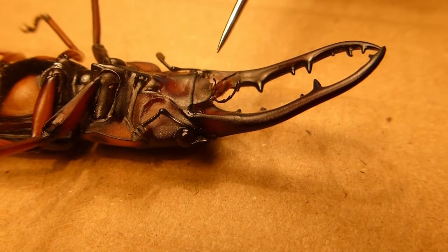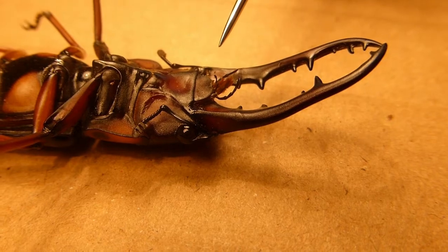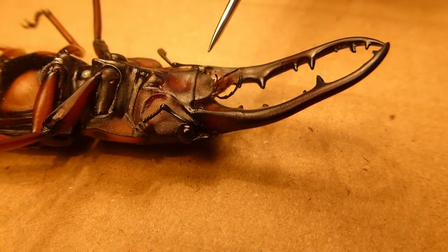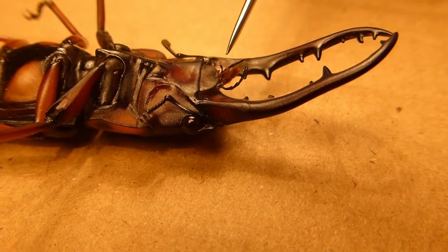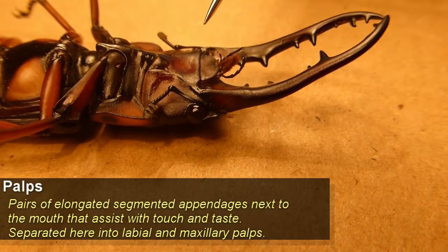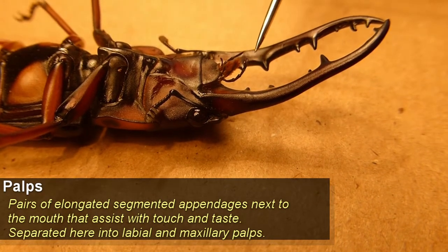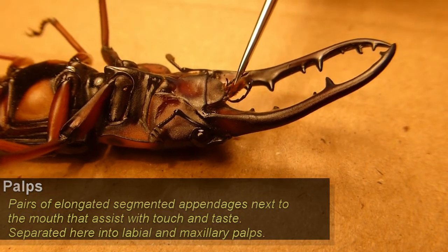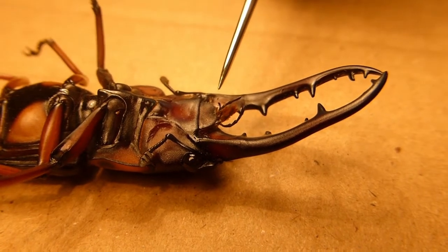Unlike some species of beetle that do not eat as adults, this one does — it has mouthparts which you can see here. Some species will just rely on the energy reserves they built up as juveniles, however this one will eat. The mouthparts are divided into three sections: the smaller ones at the bottom are the labial palps — labial meaning lip — then the maxillary palps up here, maxilla being the equivalent of the jawbone in mammals, and these in the middle are the galea. The palps will be used for manipulating objects near the mouth.